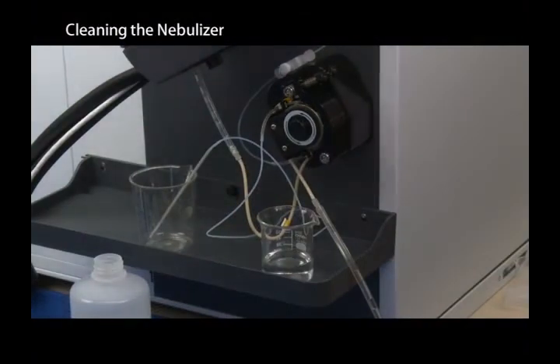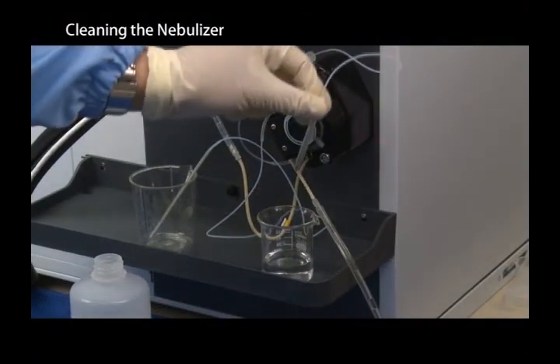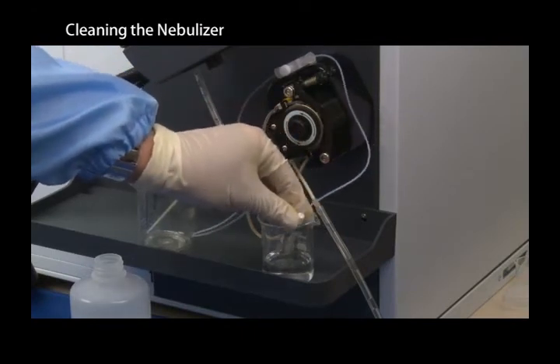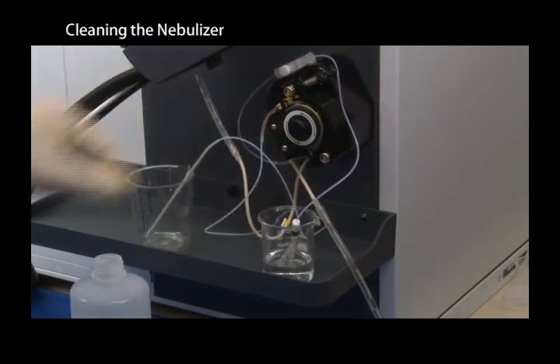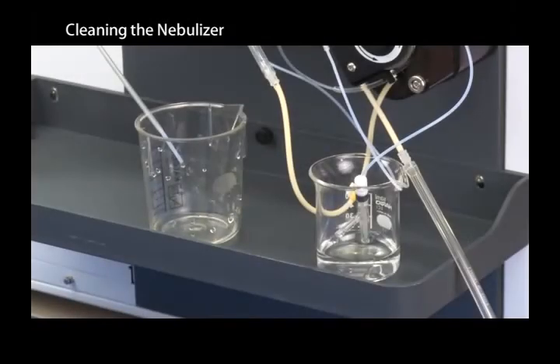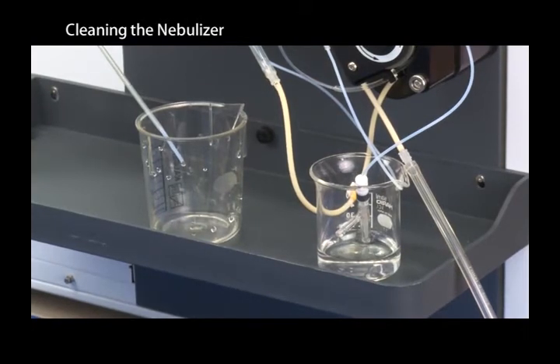Reverse the peristaltic pump tubing for the sample on the peristaltic pump, and then place the tip of the nebulizer in pure water. Run the peristaltic pump at high speed and flush pure water from the nebulizer tip toward the sample uptake for a few minutes.